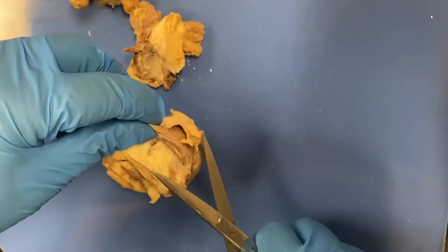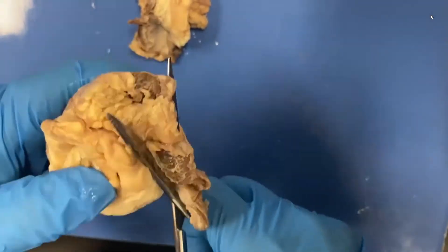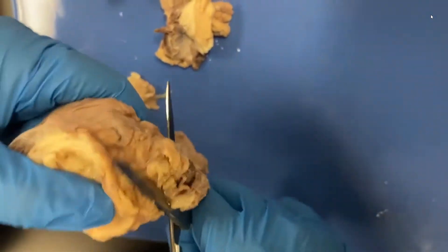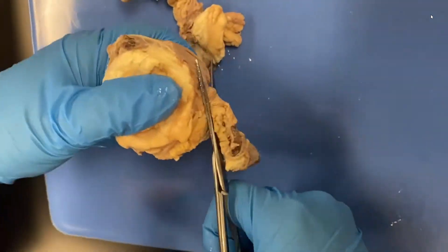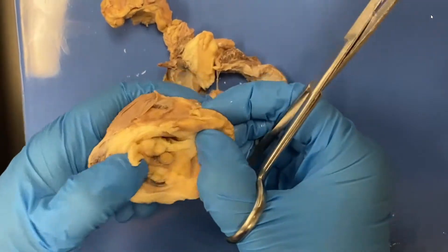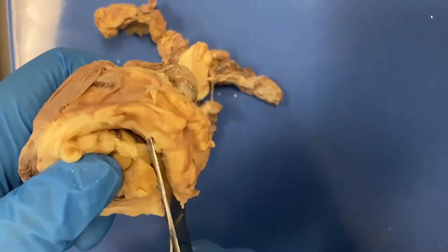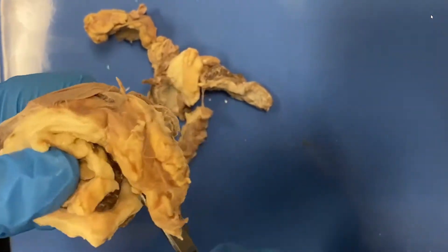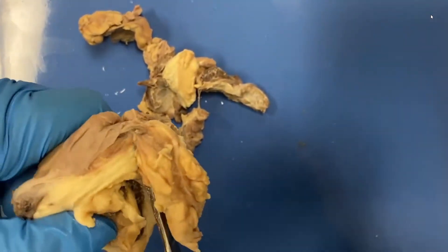You may ask me which one is which, and I won't be able to tell you because I don't know where the superior side of the orbit is, since it's now outside the skull. So I'm taking this off a little bit so you can get a general idea of how small the eye really is. Look at all that fat — it protects that eye.